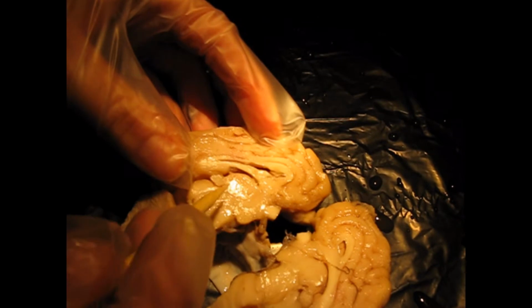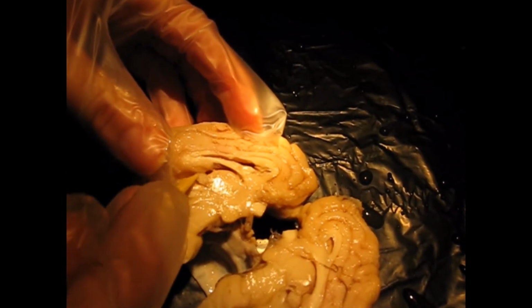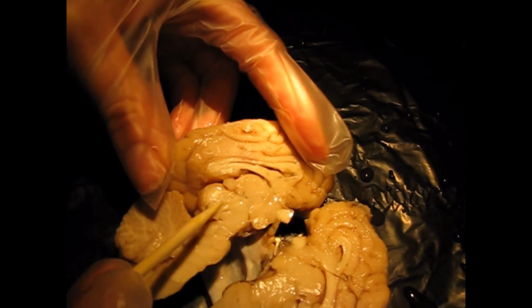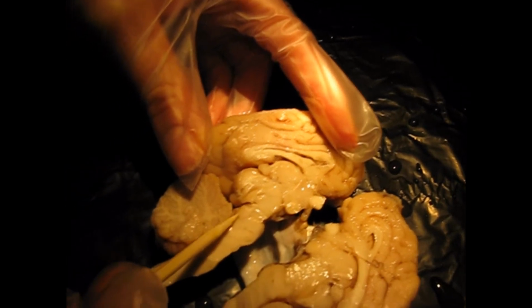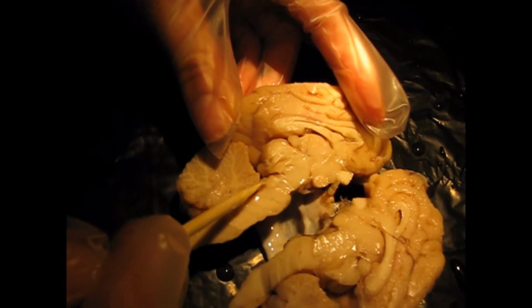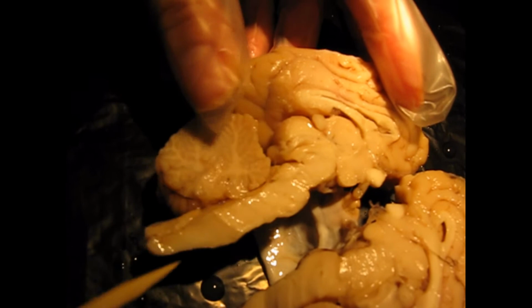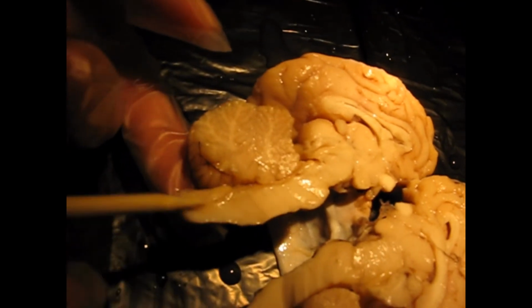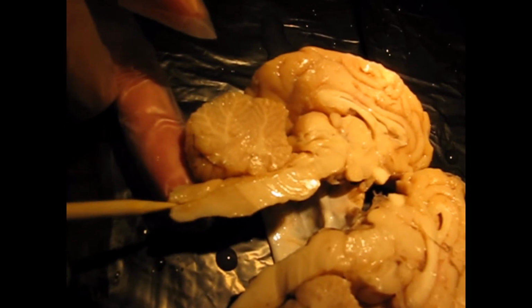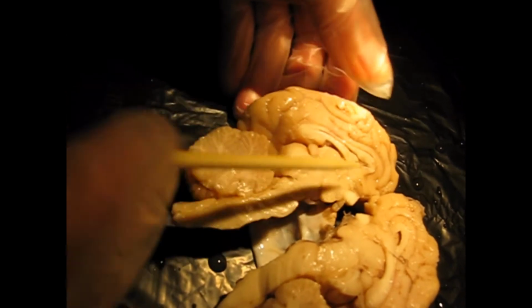Okay, and then the cerebrospinal fluid is going to travel from the third ventricle around the diencephalon, through the cerebral aqueduct, which is right here, to the fourth ventricle, which is right here, right next to the cerebellum, and then that cerebrospinal fluid would either decide to travel around the brain or head down the spinal cord through the central canal, which if you make a really nice mid-sagittal cut, you would see that right here. So, very good. All right, so let's go ahead and talk about the cerebrum a little bit more.